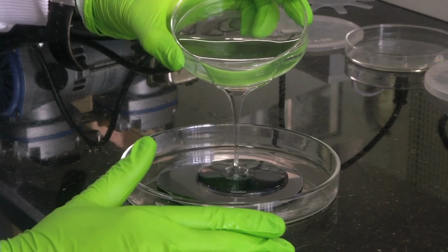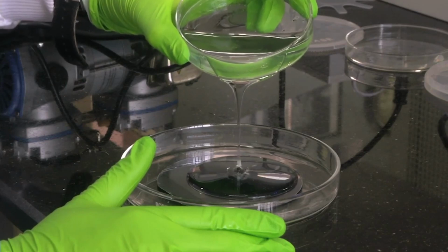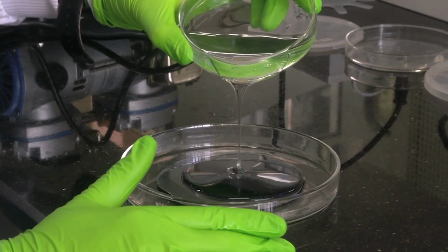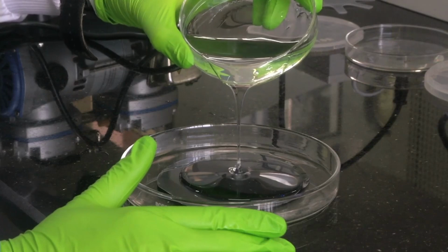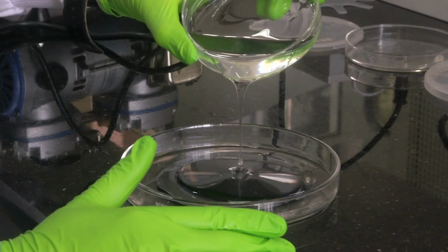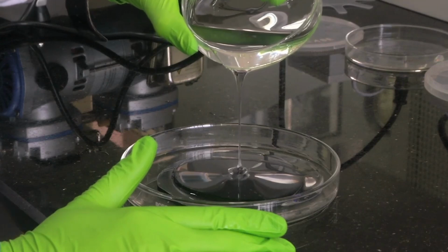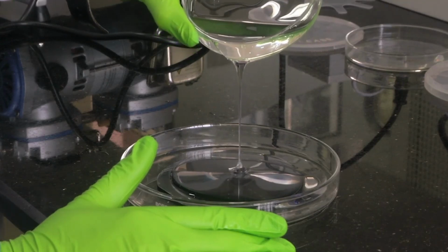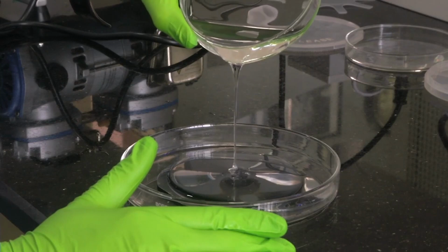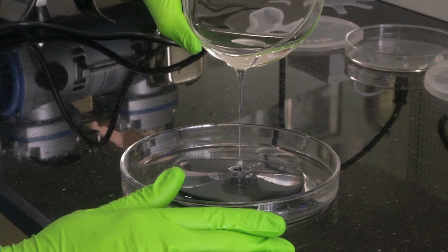So as and when we pour, more air bubbles are getting formed. So we have to do one more level of desiccation to remove the air bubbles in the second round, after pouring the PDMS onto the mold. So we are pouring the PDMS onto the mold. This process also creates air bubbles.